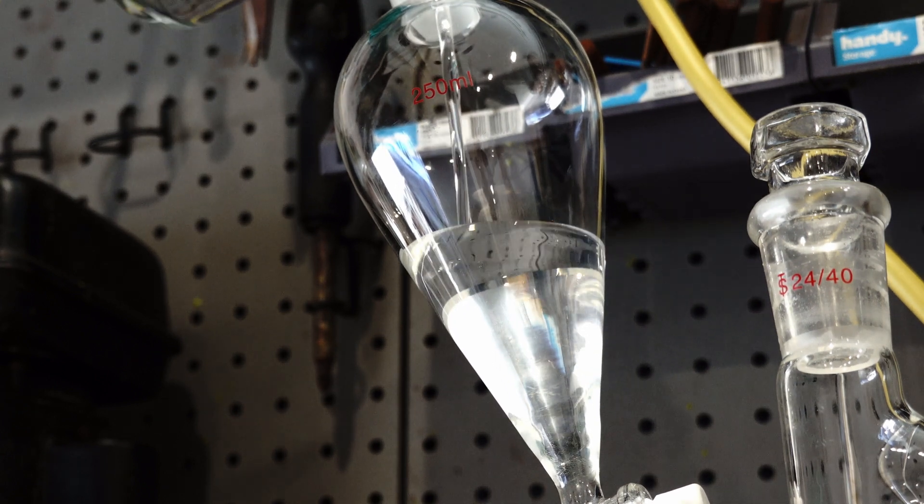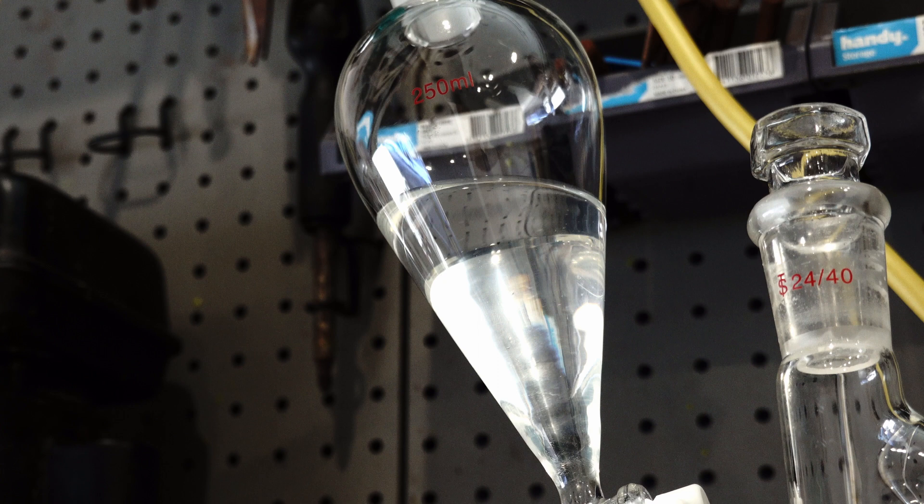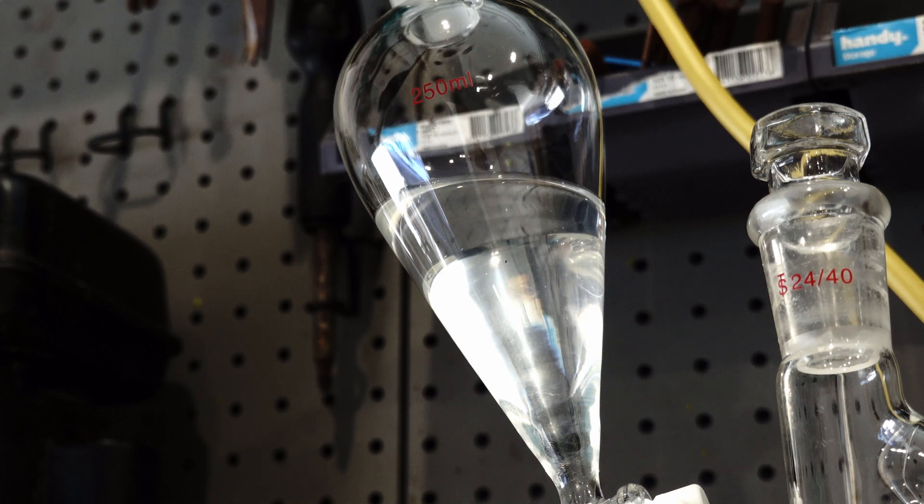Ideally, the use of a pressure equalizer dropping funnel would be ideal. However, I didn't have one on hand so I went with a separatory funnel.